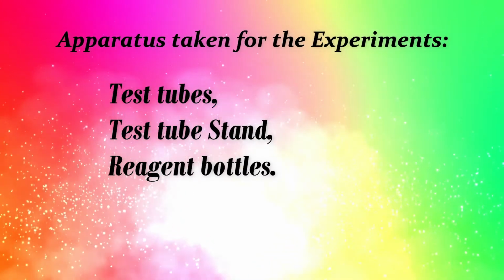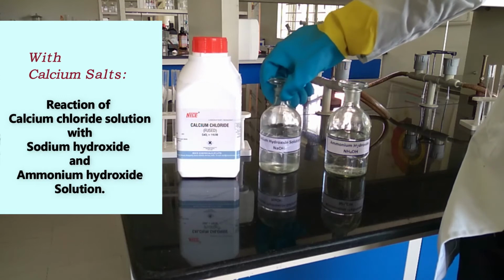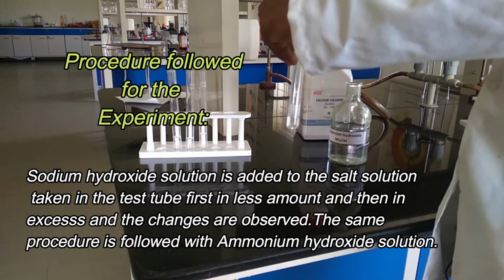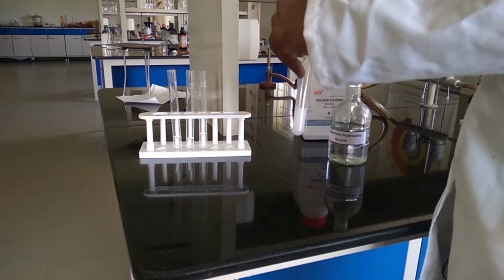The apparatus taken for the experiments are test tubes, test tube stands, and reagent bottles. The effect of sodium hydroxide and ammonium hydroxide on calcium chloride solution. First, we add sodium hydroxide solution in small amount. It turns into a white color precipitate of calcium hydroxide. We keep on adding in large amount.